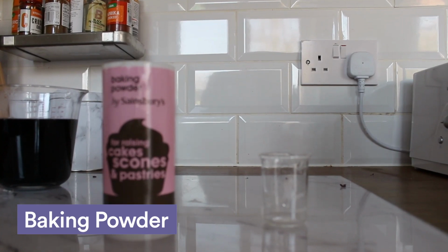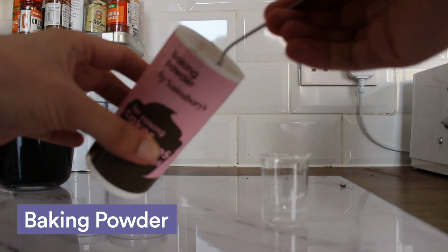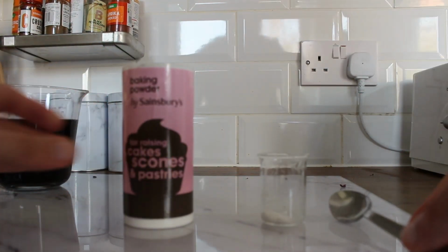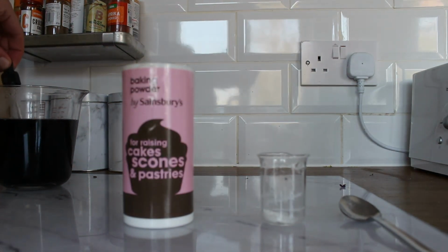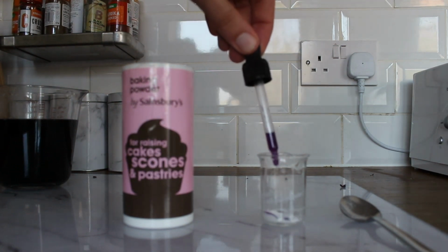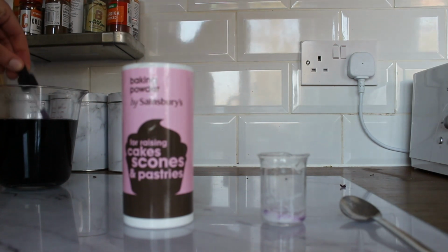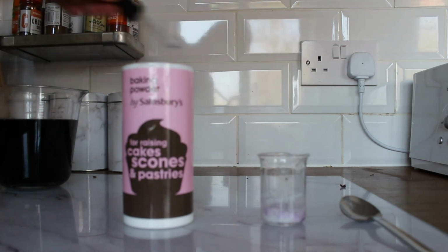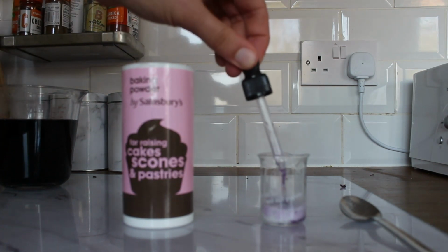So in this experiment I'm going to be using some baking powder which I've had left over from making some cakes in my spare time. I'm about to add some of the purple indicator. Now, you won't be able to see exactly what colour it is straight away because it needs a little bit of time to mix properly as it's a solid. Baking powder is mostly made out of a chemical called sodium hydrogen carbonate, and it's used in baking because when it's heated it releases some carbon dioxide.